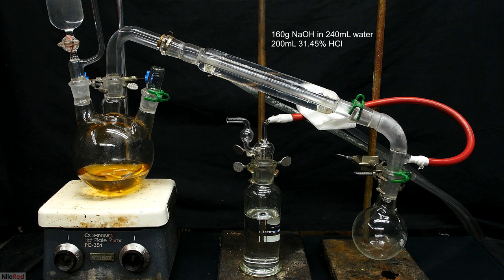The hose is expertly attached with some electrical tape, and it leads to a gas bubbler that's filled with hydrochloric acid. As we progress through the next few minutes, you'll see why each part is important.